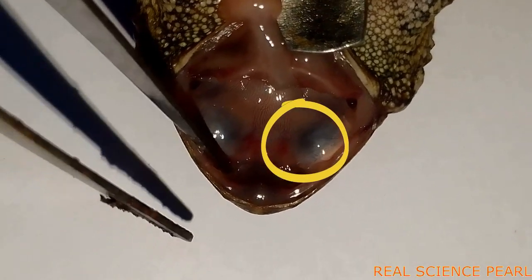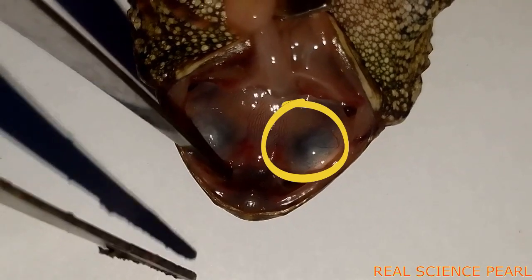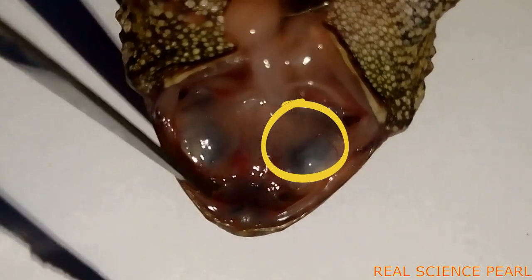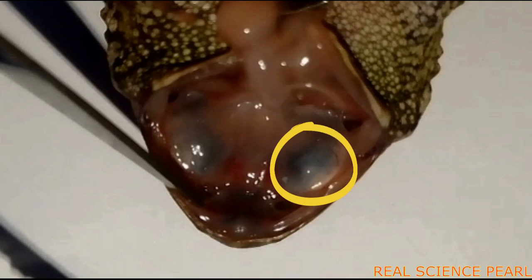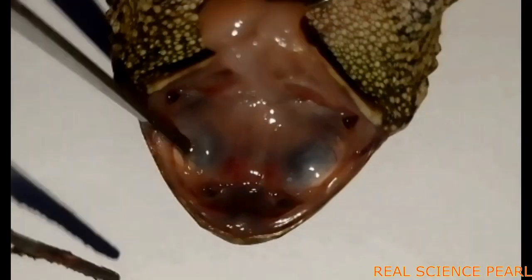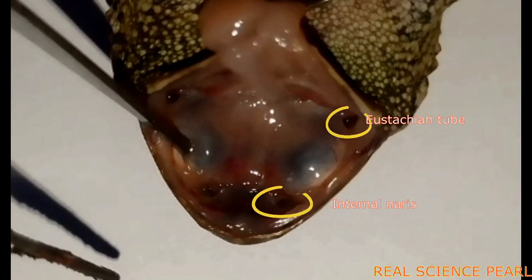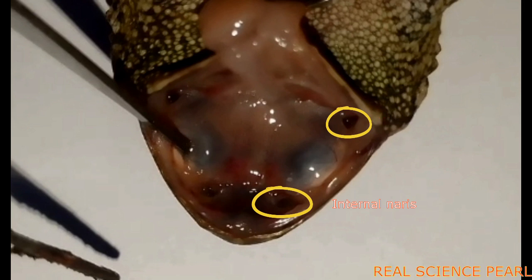The eyeballs are oval, pale colored, and protrude into the roof of the buccal cavity. We also have the internal naris, or nostrils — there are two of them — and they are responsible for gaseous exchange.